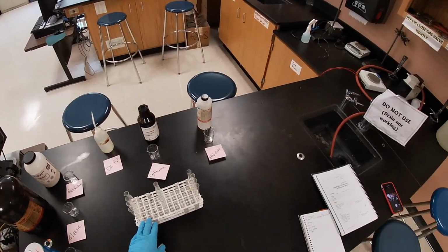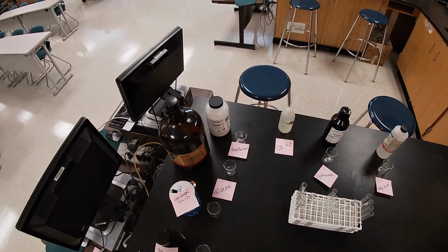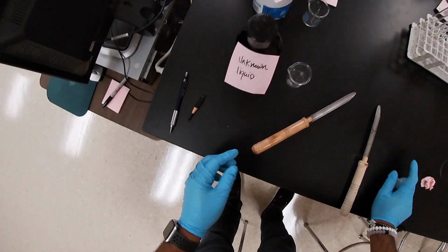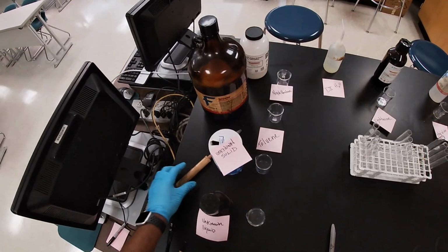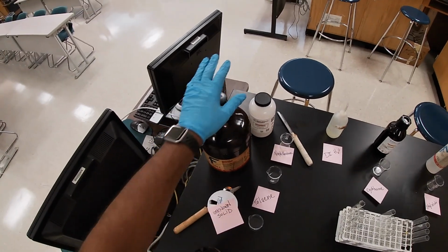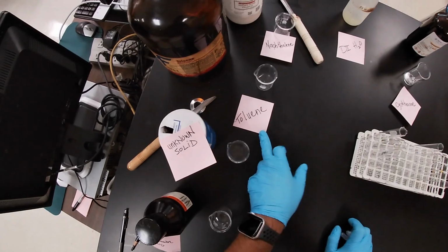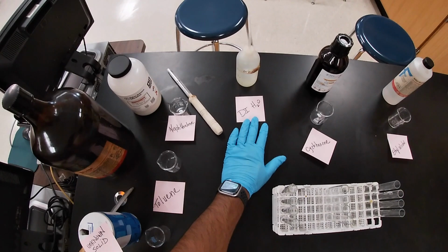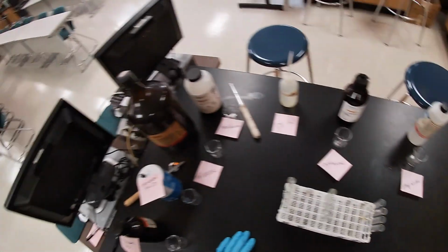And so I have the test tubes here. So what we're going to be using is I have some liquids in here that I'm going to be pouring out. So I have my unknown liquid, as you can see, and then I have the unknown solid. Hopefully you can't guess what it is. And then we have toluene, and then here we have naphthalene. Hopefully you can see that I tried to write them bigger on the post-it so you know exactly where it is. And then here we have deionized water. Here we have cyclohexane, and here we have ethyl alcohol.